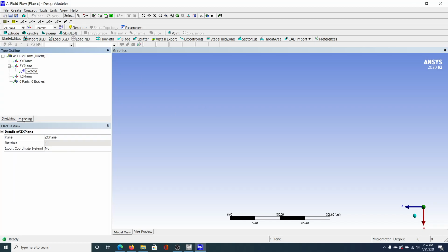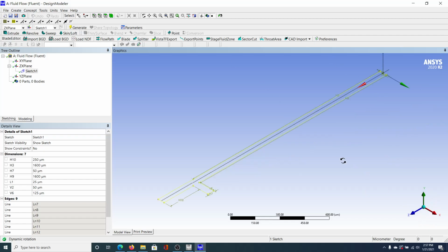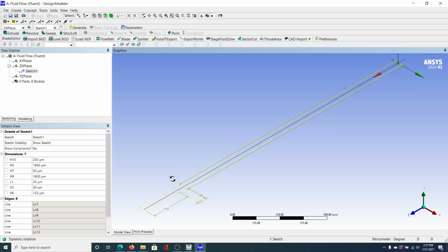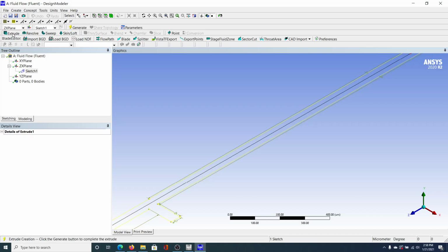Okay. And then go back to the model. This is our sketch. Whoops. What's going on? All right. So the next thing we want to do is we want to add an extrusion, right? Because this is obviously the mid-plane. We want to make it 3D. So what we're going to do is add an extrusion. And I think we do that by clicking extrude.